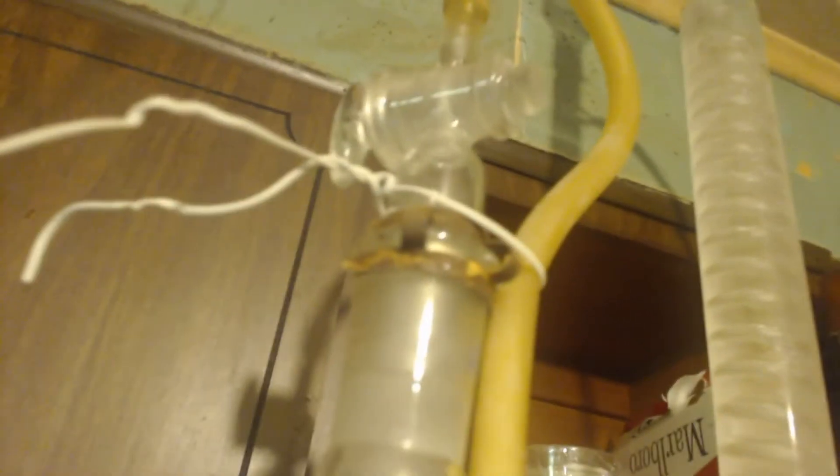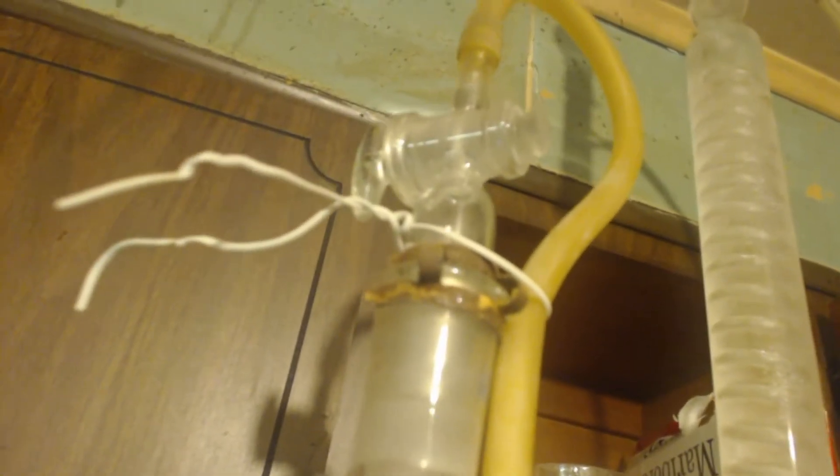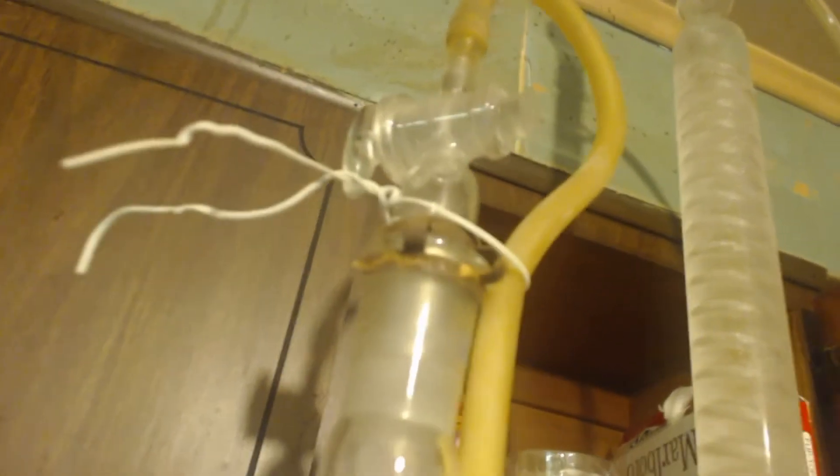Here's my receiving flask, but it's not set up like a regular receiving flask — on top is a condenser, a water-cooled condenser. Because the gas coming up is going to be hot as heck. So it comes out and goes up into the condenser. I have a valve on top with a small hole for the gases to get through, so it gets trapped and condenses some of it out. You can see it's dripping.